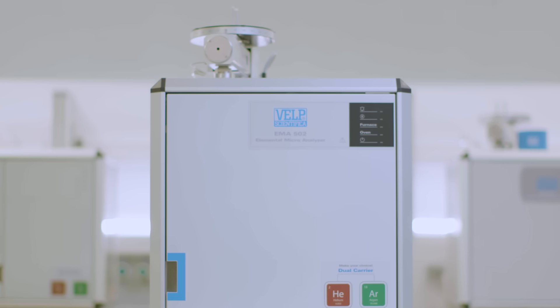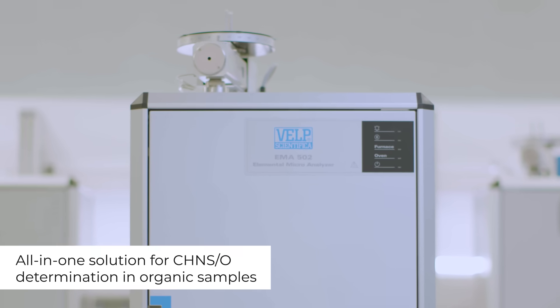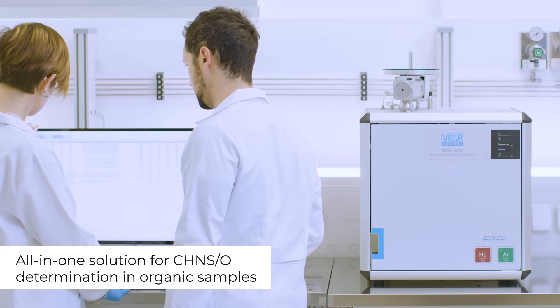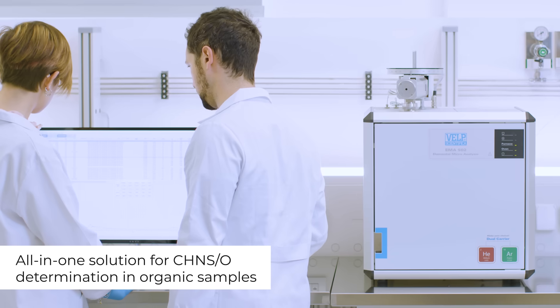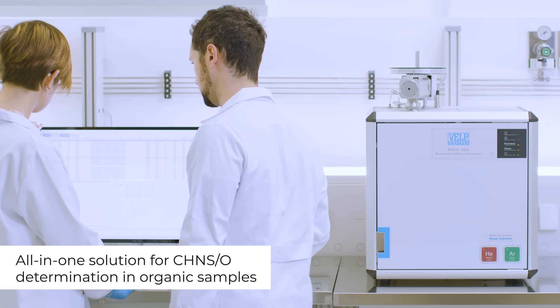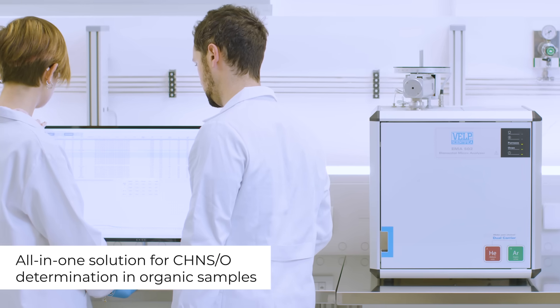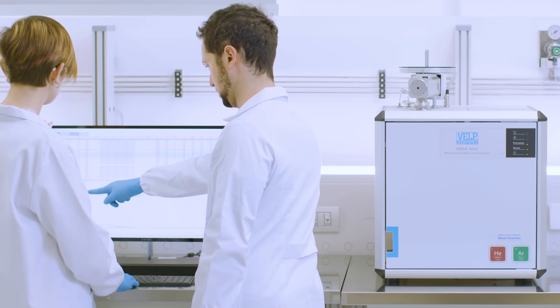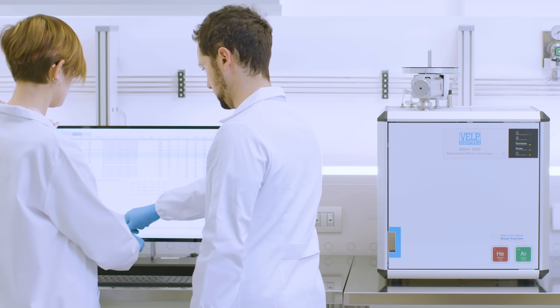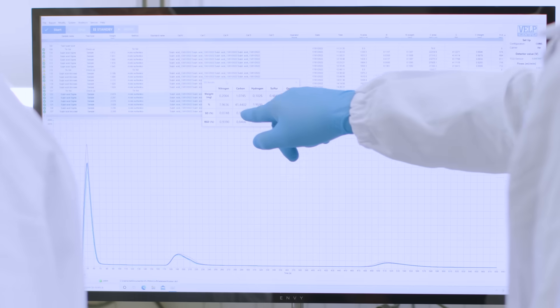VELP EMA502 Micro Elemental Analyzer is the all-in-one solution for carbon, hydrogen, nitrogen, sulfur, and oxygen determination in organic samples following official reference methods.